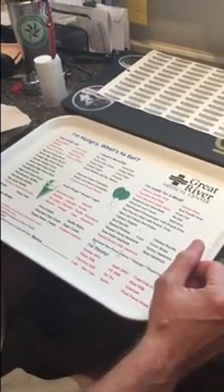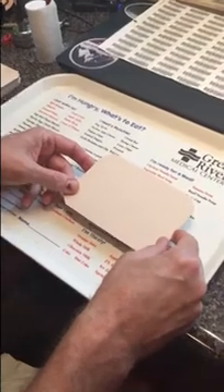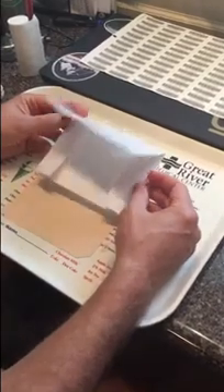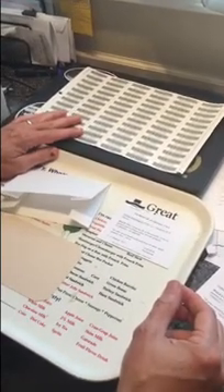First I want to show you all the tools I use when processing lichens. We have a cardboard stiffener — a piece of cardboard used to glue the lichen onto or support it, because lichens are held upright in packets. I also have a lichen packet, or bryophyte packet as they're sometimes called, which is the final place the lichens are housed. I have a label already prepared with the identification and location of the lichen, barcodes for databasing later, cotton padding for some lichens, scissors, a pen, some glue, and last but certainly not least — the lichens themselves.